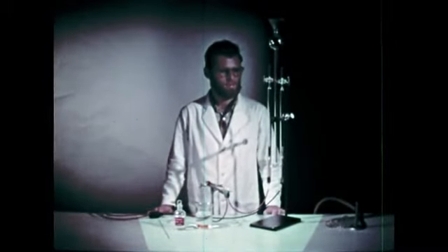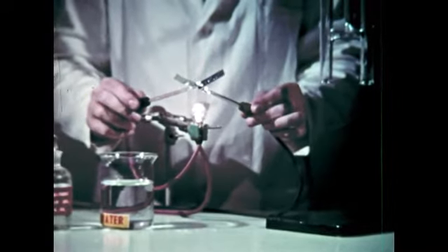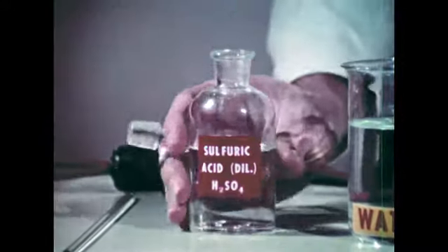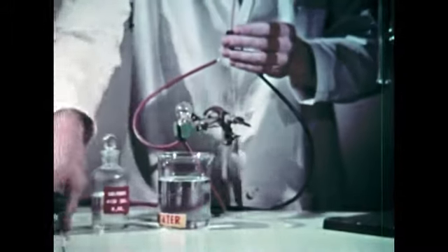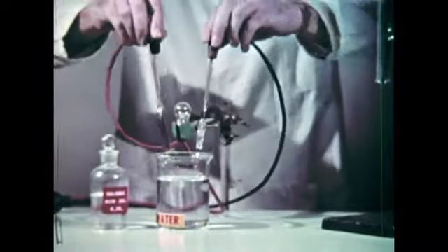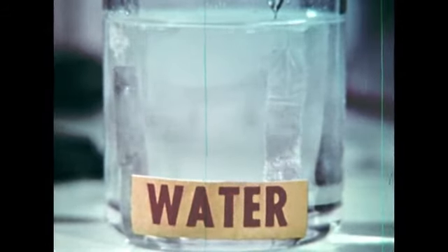The separation of oxygen through electrolysis of water is also a common industrial method. Two electrodes are used to pass an electric current, as shown by the light. However, distilled water does not pass a current, so we have to add an electrolyte, sulfuric acid in this case. The electrolyte provides ions which can move and allow the current to flow. The light goes back on, showing that the ions are now being drawn to the poles.